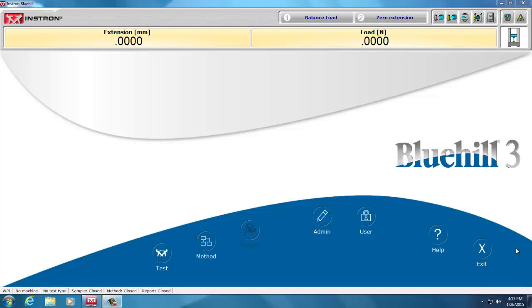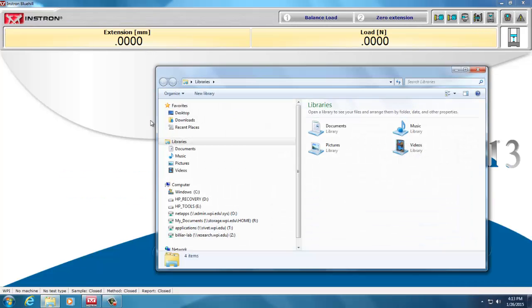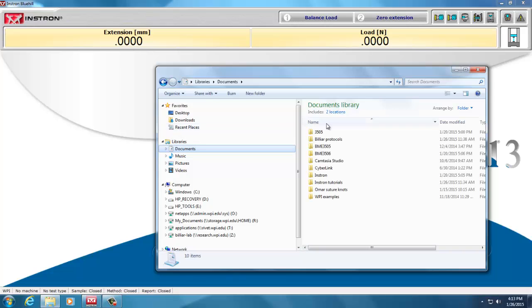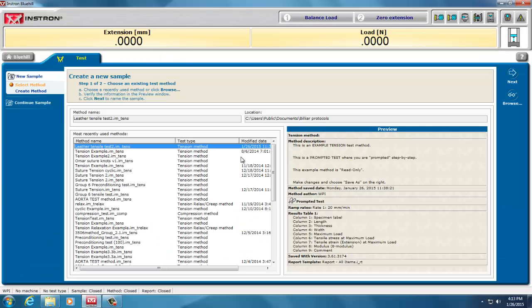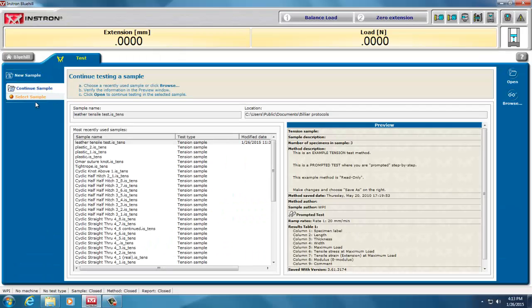It's very annoying when you do a test and you can't find the data after the test, and sometimes it's tricky as to why it is saved in certain places. So if I can't find my file, I go under, let's say, my documents and 3505, and I don't see my data there. So if I go back to test, and I say, let me continue my sample, and the last one I did was called leather tensile test.